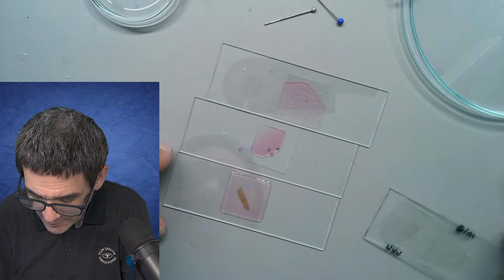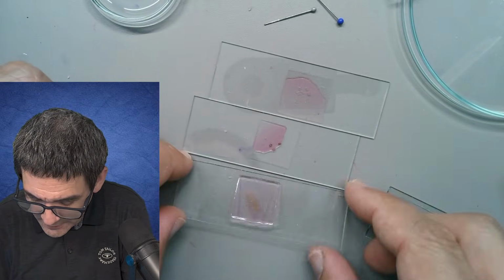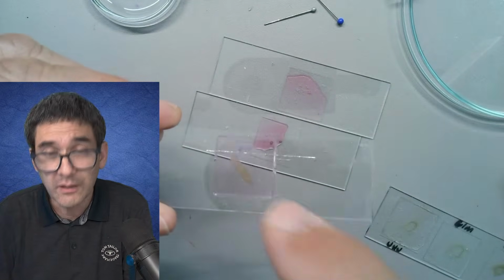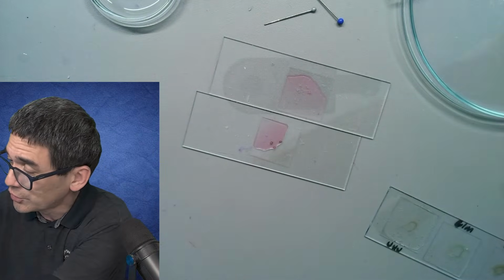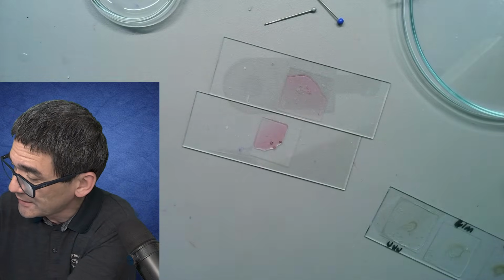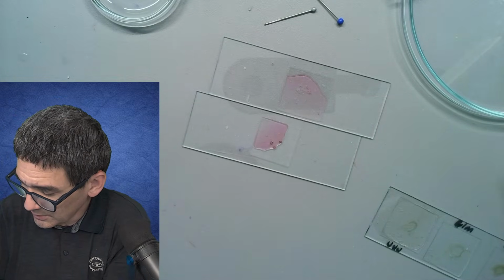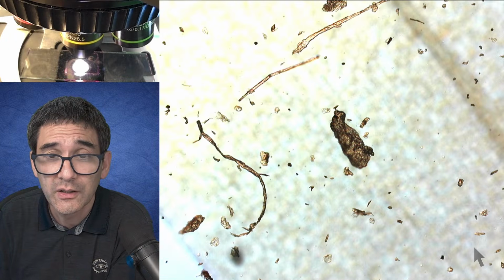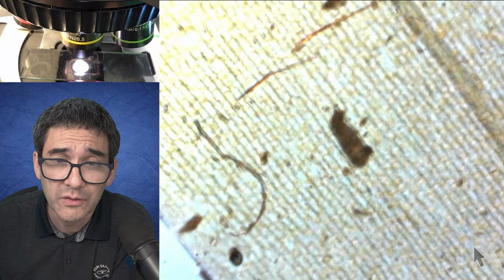We're going to have a quick look here, because specifically disappointing is the leaf of Elodea, which was actually quite nice and green and crisp, but is kind of degraded now a little bit. I just want to show this to you. So it shows that not all permanent slides are made for eternity, unfortunately. There's lots of dirt here.